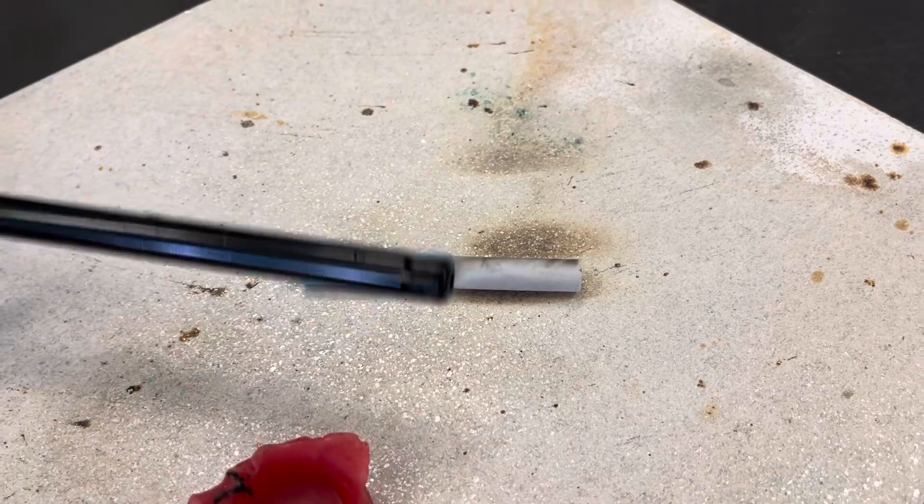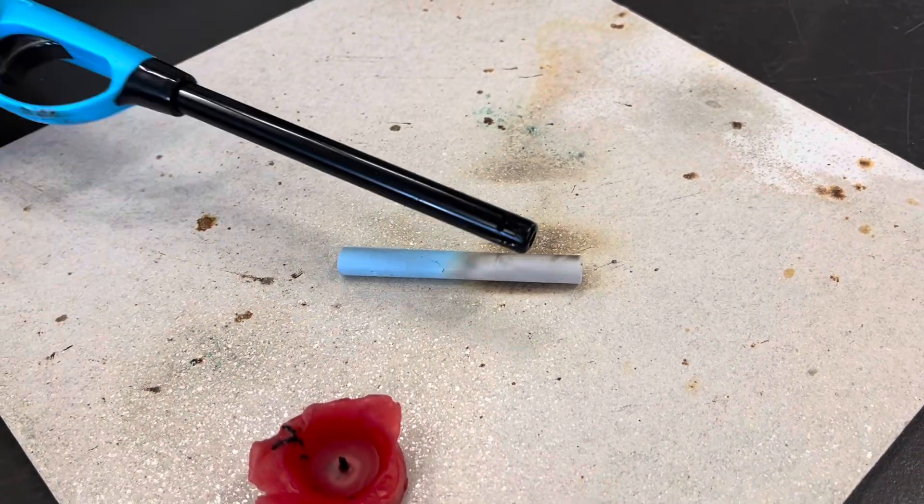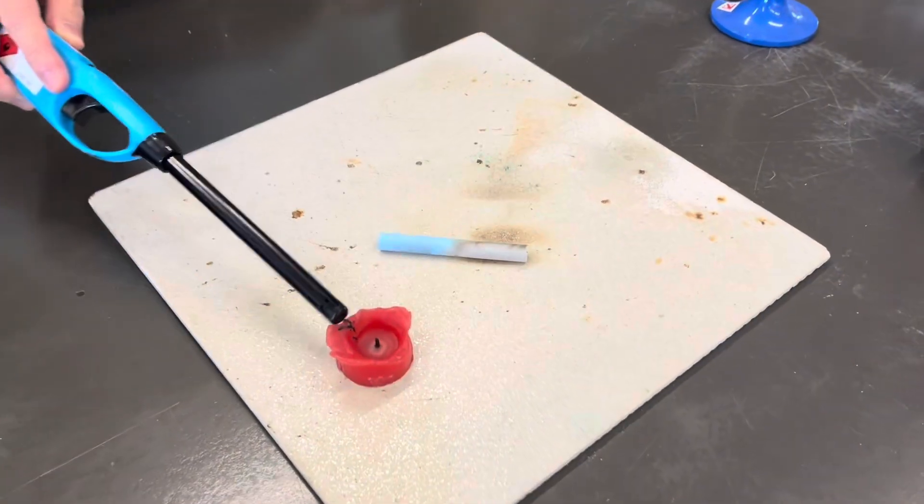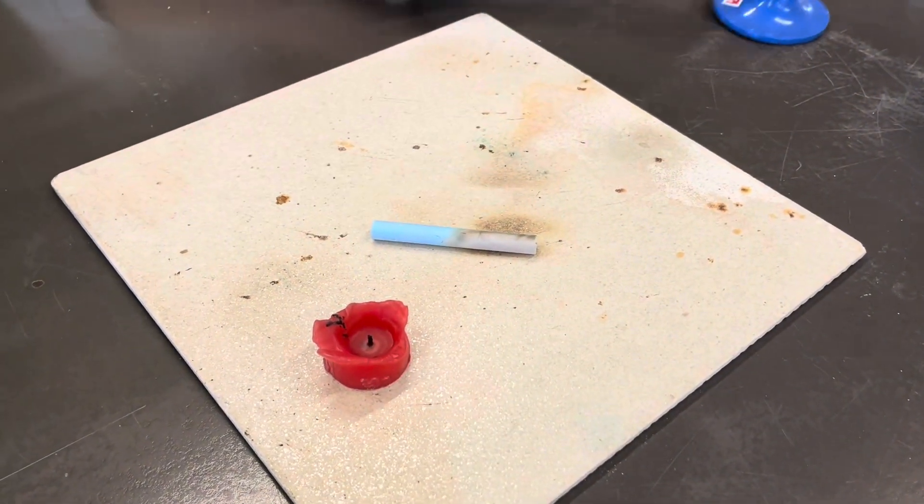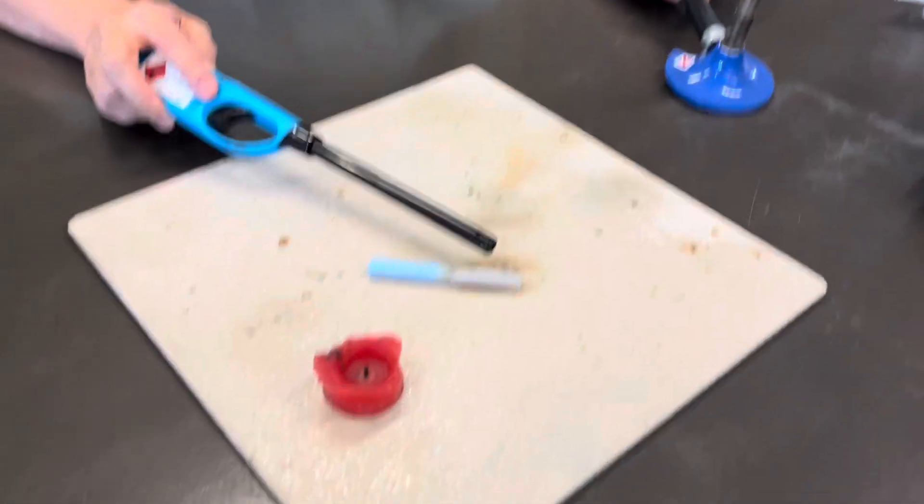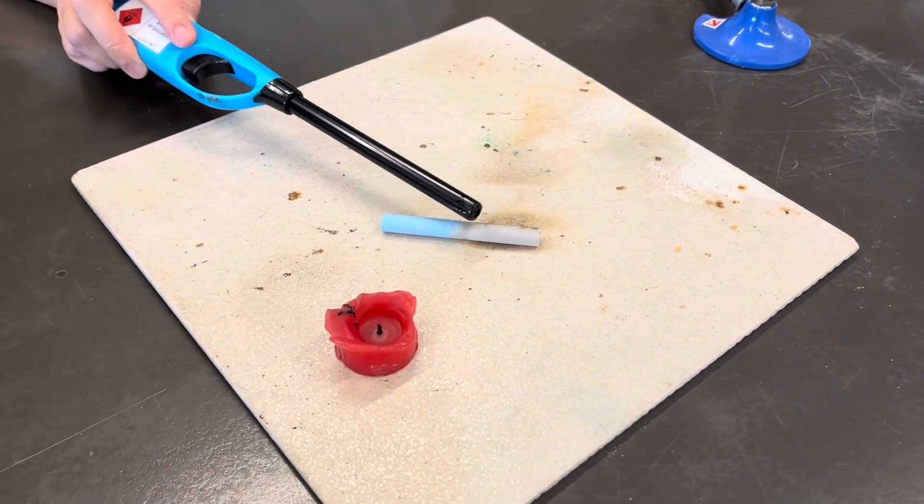Can you tell me what happened to the chalk? Why when I bring the flame over the candle, it turns black? But when I am going to use a Bunsen burner to heat it, it will remove those black substances.